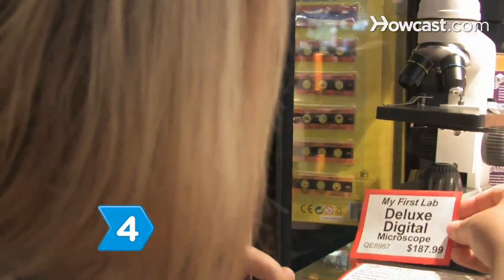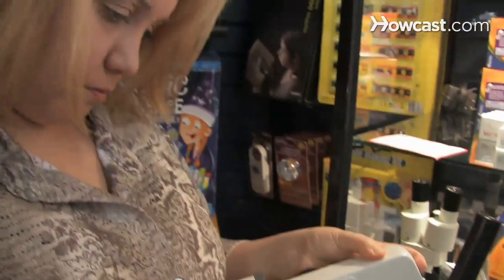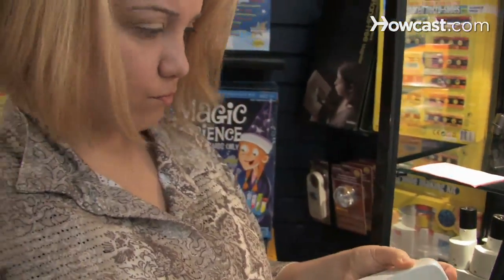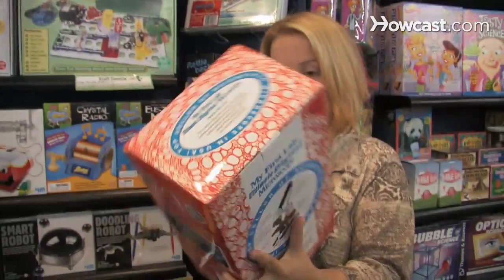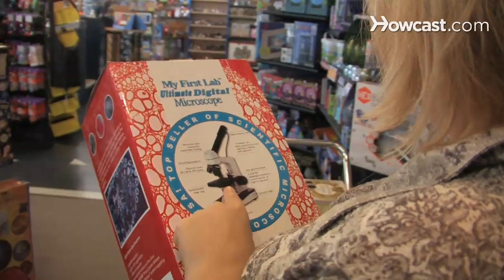Step 4. Consider a digital microscope if you wish to display images on a computer, manipulate images, and share images.